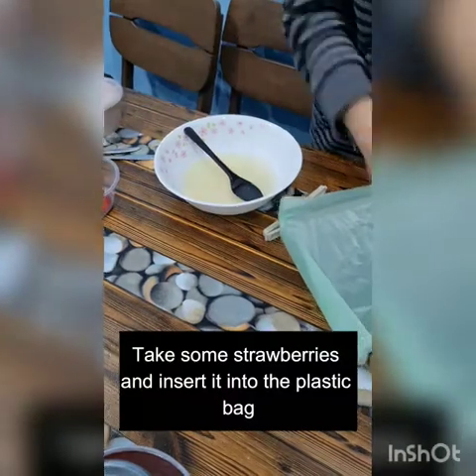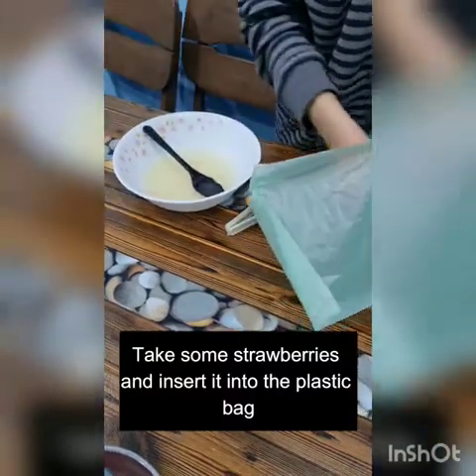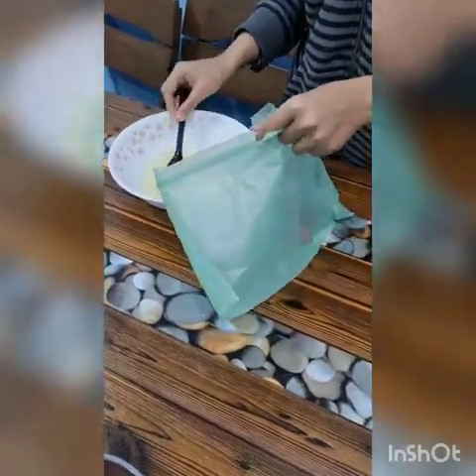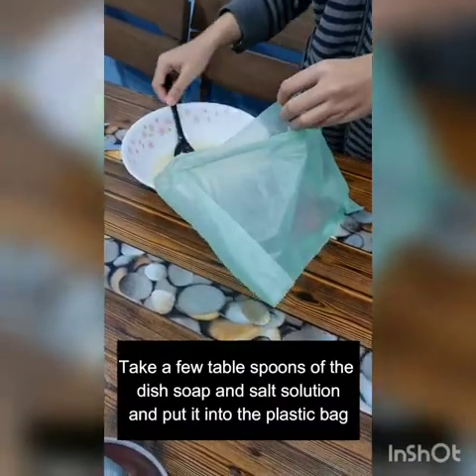Some strawberries are put into a plastic bag. A few tablespoons of the mixture was added into the plastic bag.